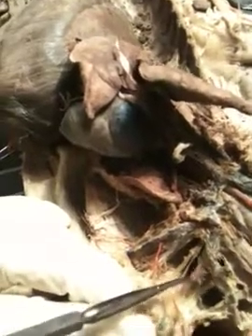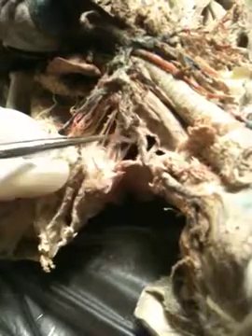What about this one? Oh, what did we say that was? Is this a sub... Subscapular vein, and then the cervical, or what did we say it was? That one was the transverse scapular vein. Transverse scapular vein, which branches out from the external jugular vein that runs along the cat. That would be our right. No, it's our left. Left external jugular vein.